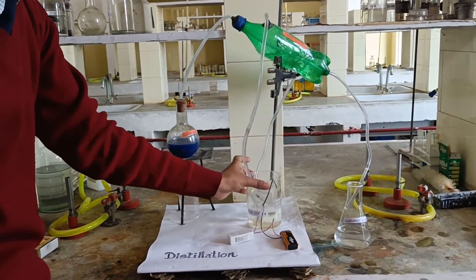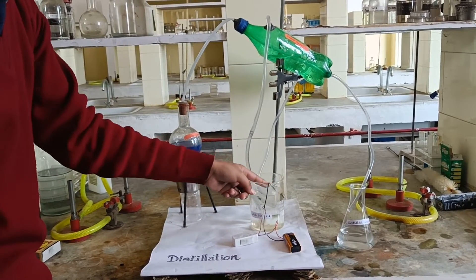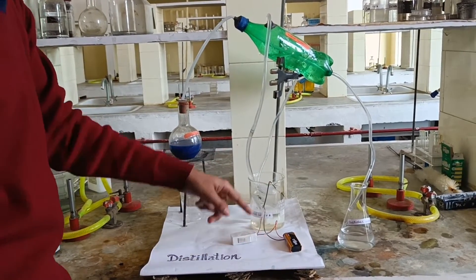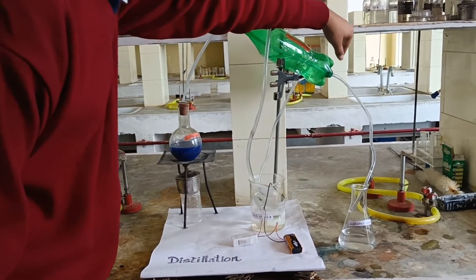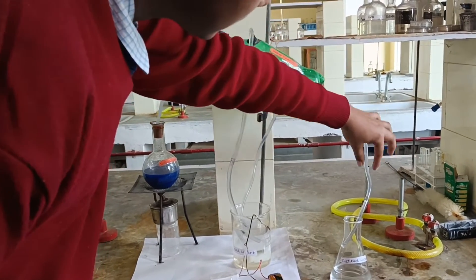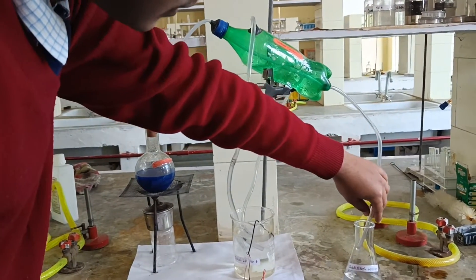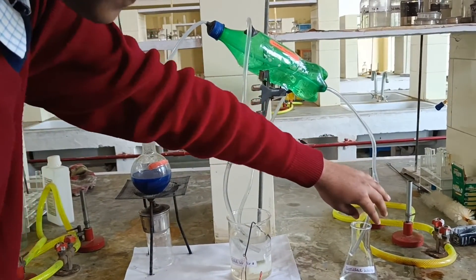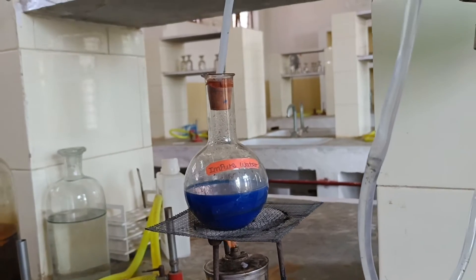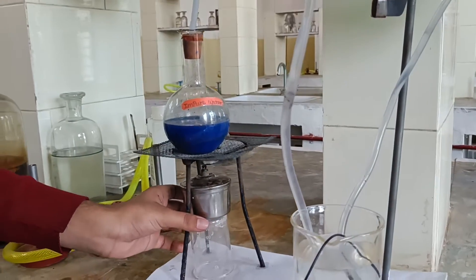Here we have cold water. Here we have a pump to join. Here we have a pipe from here. Here we have the distilled water.